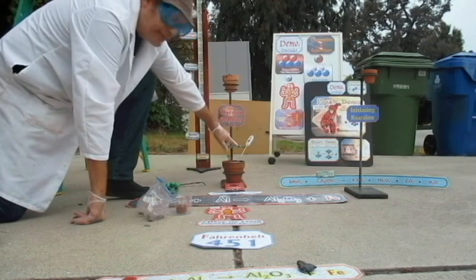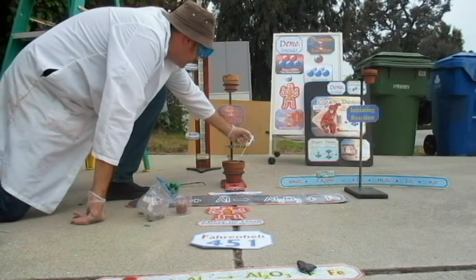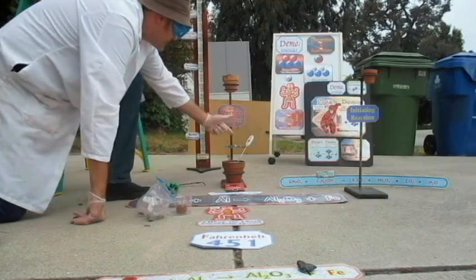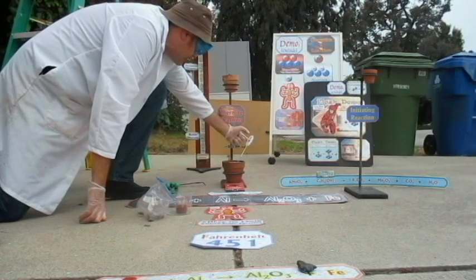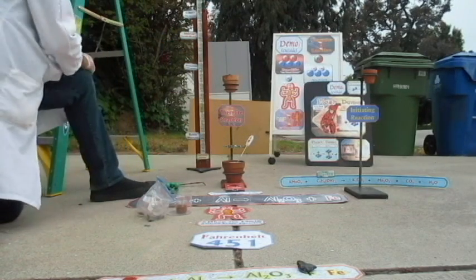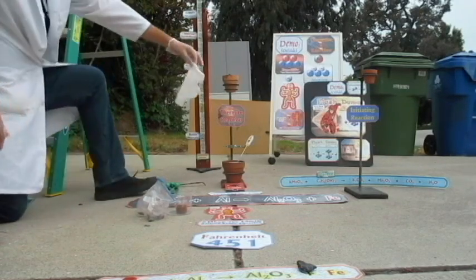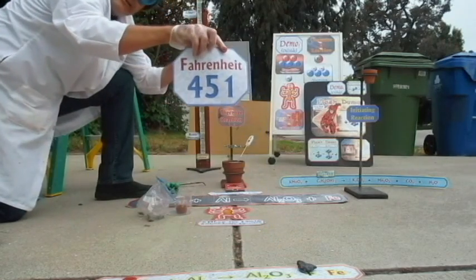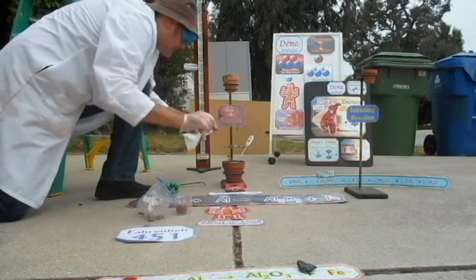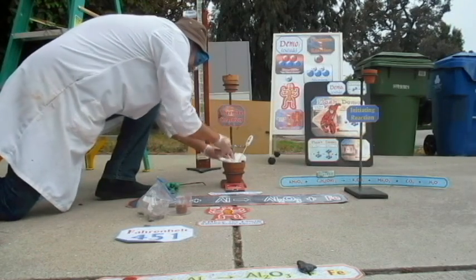This thermometer is probably gonna be destroyed by this reaction, but I have it set on max. So it'll record the maximum temperature that it reaches, okay? Also, I'm going to use a little bit of cellulose or paper, because cellulose famously will begin to combust if you reach that temperature.